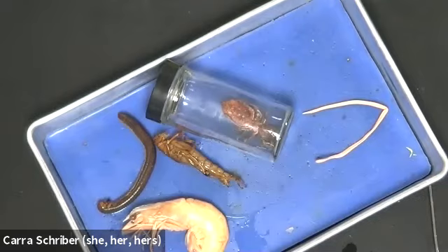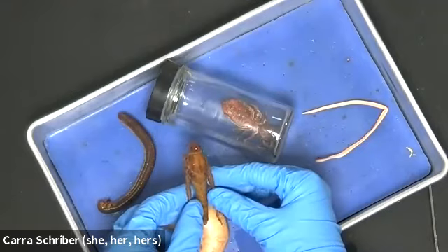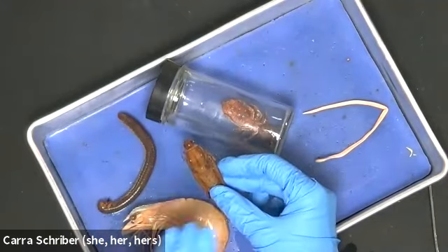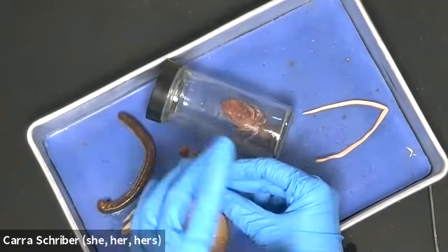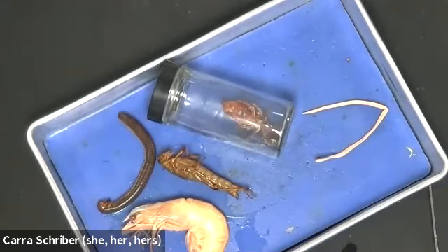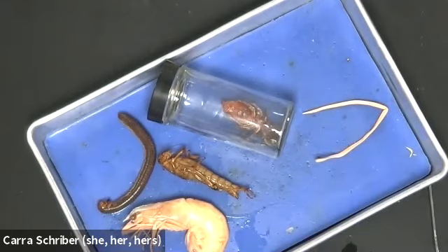So you'll see on your handout, we talk a lot about the different organ systems of arthropods, right? And so when we shed the exoskeleton of arthropods, they do that to grow. So as they get bigger and bigger, they're going to shed that exoskeleton and then grow a new exoskeleton so that they get bigger that way. The same thing is happening with this roundworm, but again, like a very different version, right? So the roundworm is shedding that cuticle.